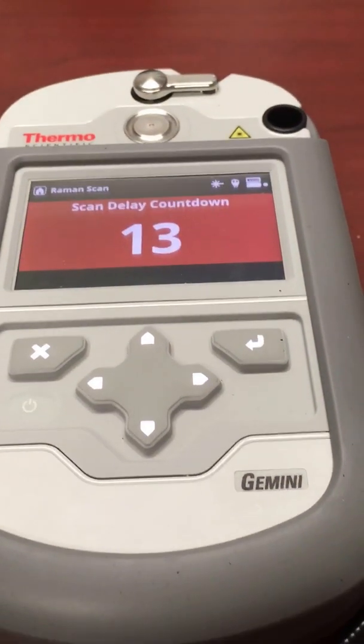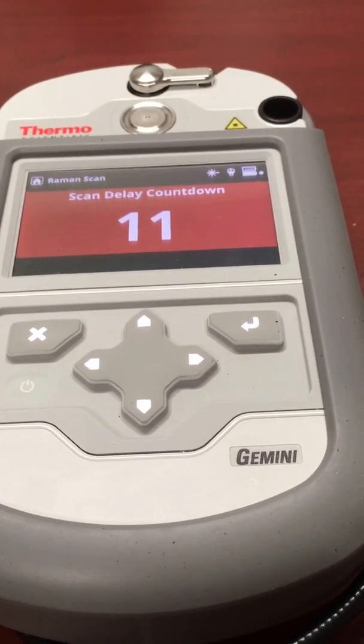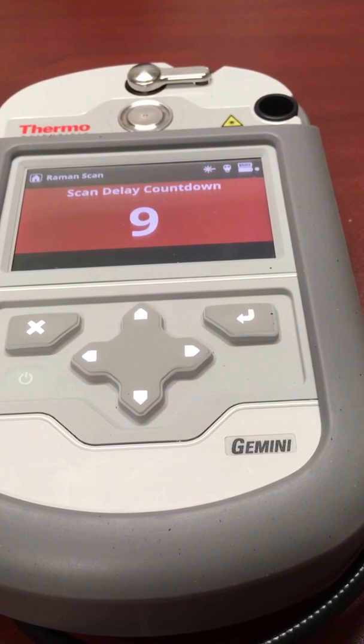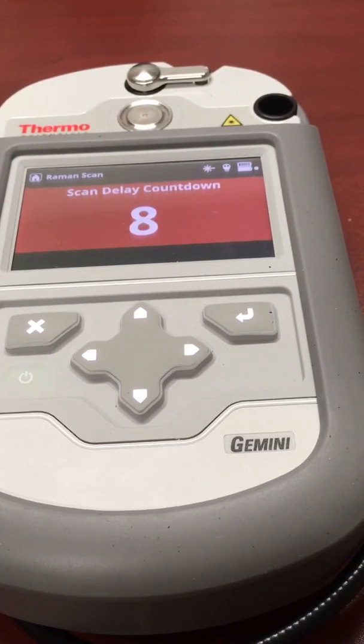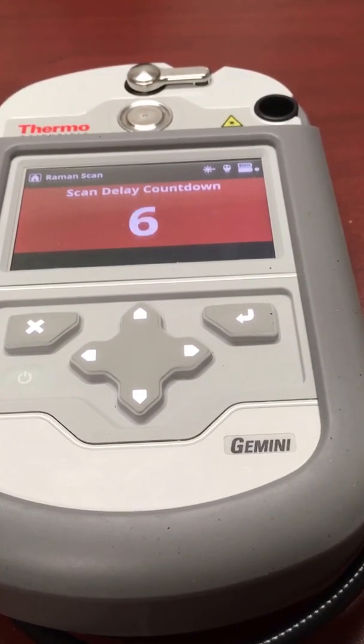There's a variable delay built in, so if you didn't know what the sample was, you could move away from it during that time, just to be safe.